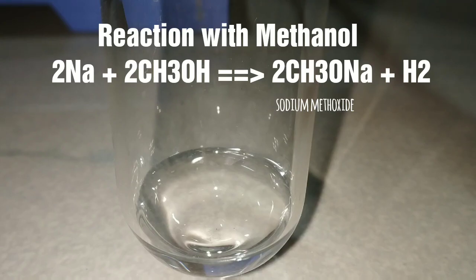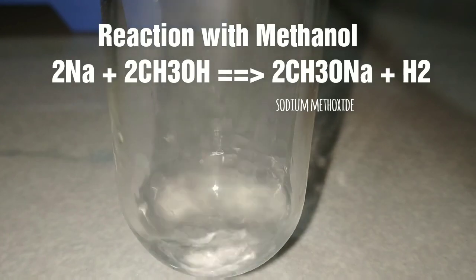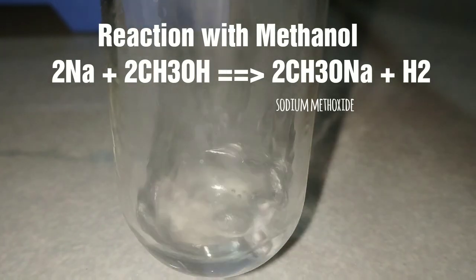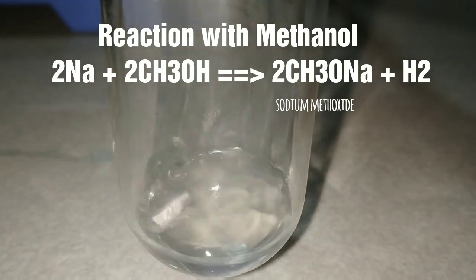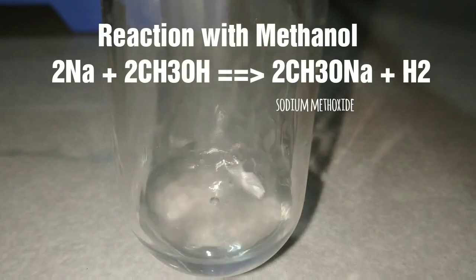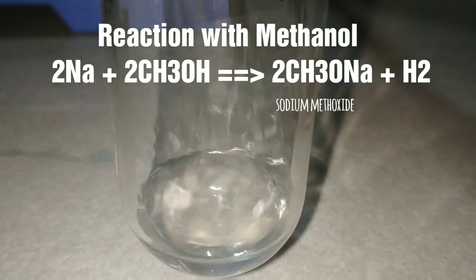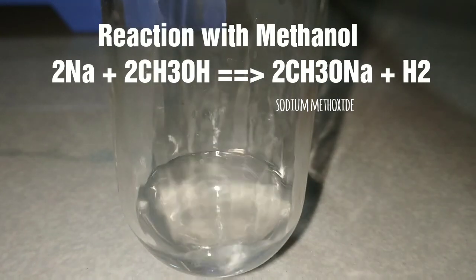Now we see the reaction of sodium metal in methanol. Sodium reacts vigorously with methanol, forming sodium methoxide, and hydrogen gas is evolved. This reaction looks exactly similar to the reaction of sodium with water, but instead of the hydroxide, here we are obtaining sodium methoxide.